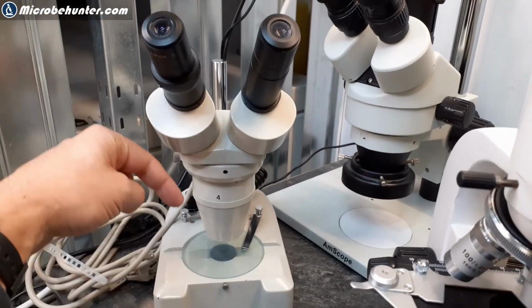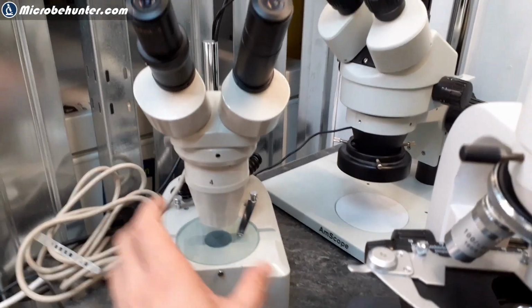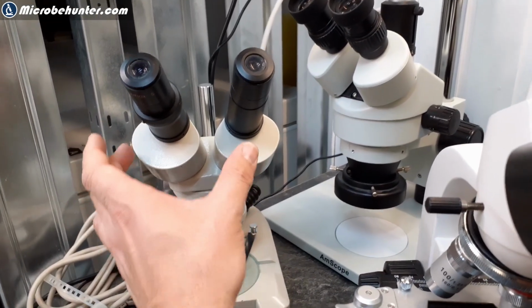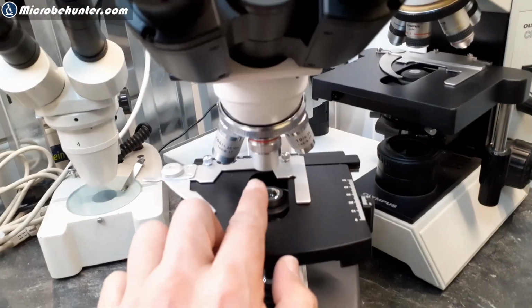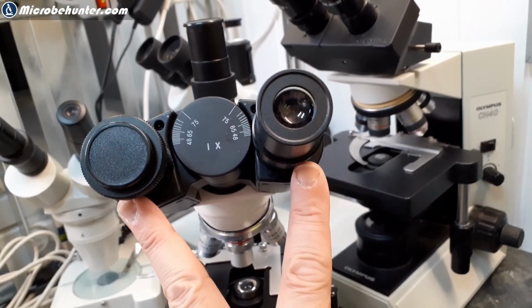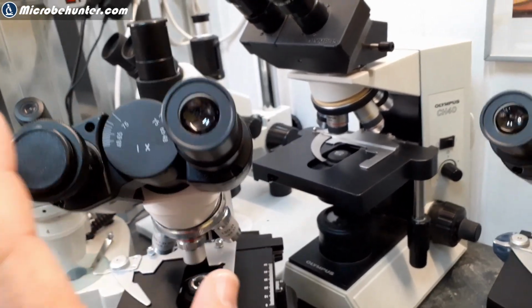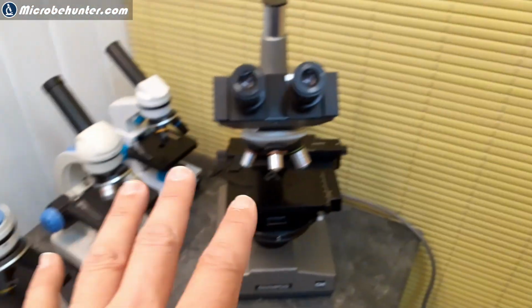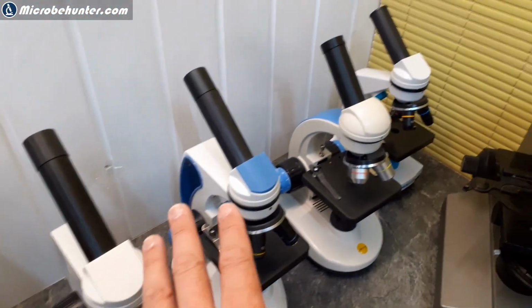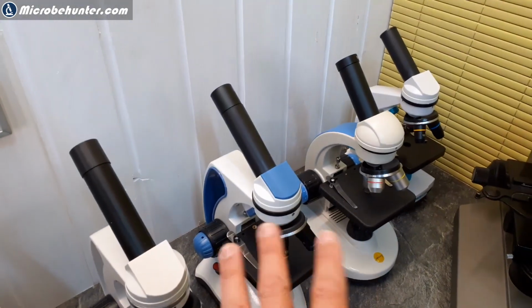So one image you look at more from the left, one more from the right. Two different images, and you get a stereoscopic view. Here there's only one image, and it's split up, so both eyes receive the same image. Therefore, there is no stereoscopic view. This is basically the same for all of those compound microscopes here, also the one over here. And those introductory microscopes only have one eyepiece for cost reasons and portability reasons. I'm going to talk about this later.